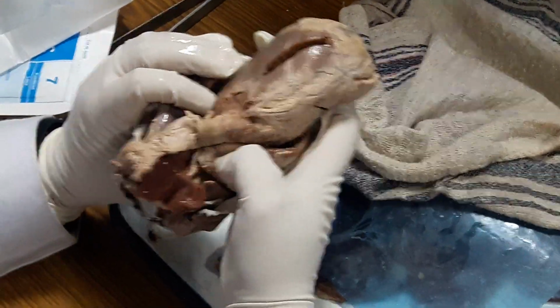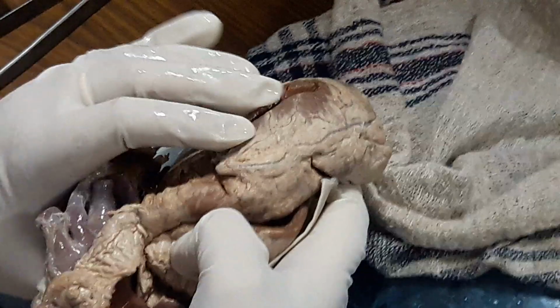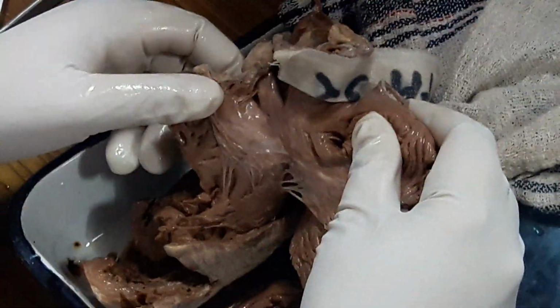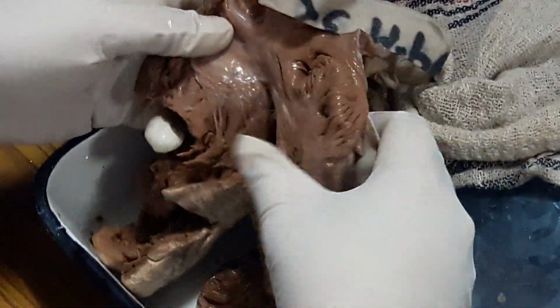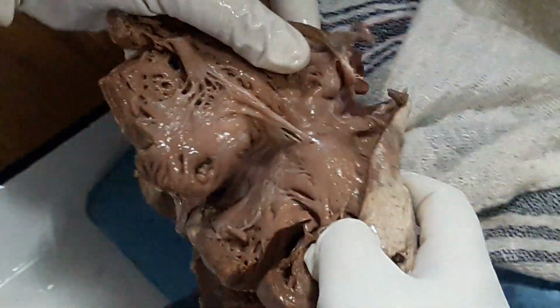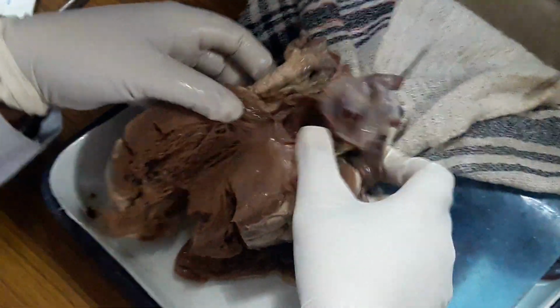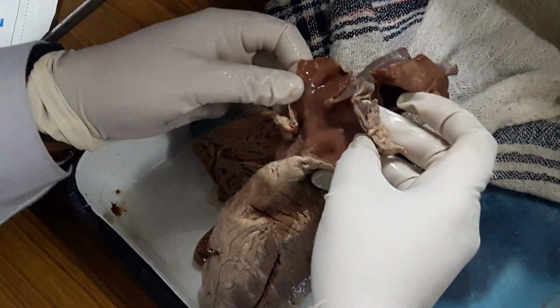Grossly, if you get a myocardial infarction, sometimes you can get a fibrinous pericarditis if there is a transmural infarct. Okay, it's not mandatory to get it in all the cases. Moreover, this patient died within about 48 hours, too early to have a pericarditis to start with. This is a tricuspid valve, which is unremarkable. Pulmonary artery, pulmonary valve. Pulmonary artery should be unremarkable, normal.